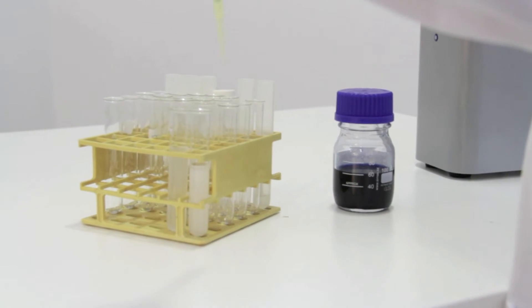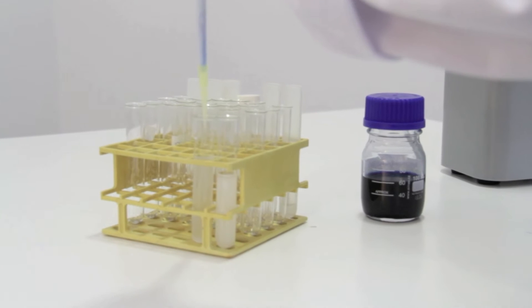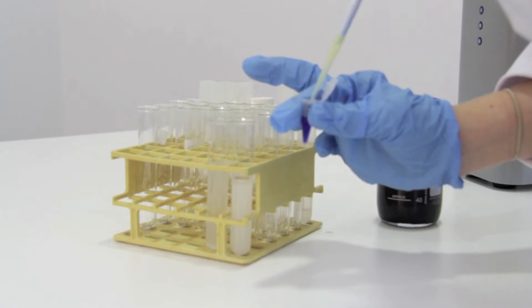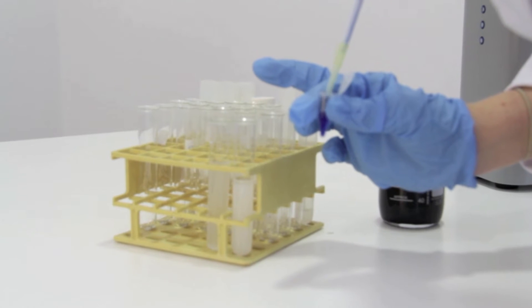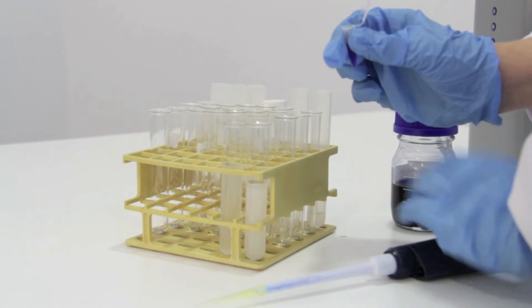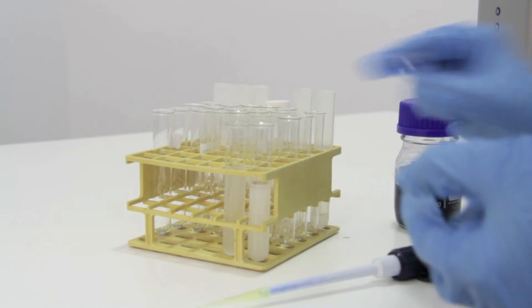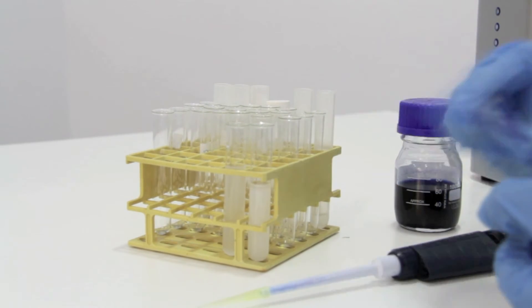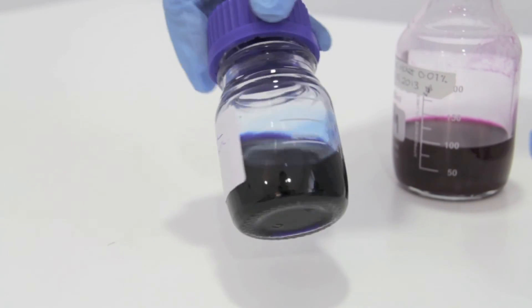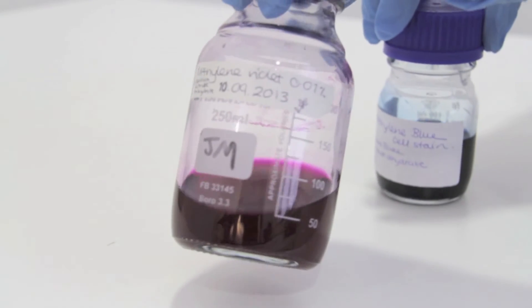The CountStar uses classic cell stains such as methylene blue or methylene violet to assess viability of yeast populations. Live cells appear colourless whereas dead cells take up the stain. The digital image technology can pick up on this to produce a percent mortality of the sample in a matter of seconds. Methylene blue and methylene violet are much safer to work with than some of the fluorescent dyes used by other automated cell counters.